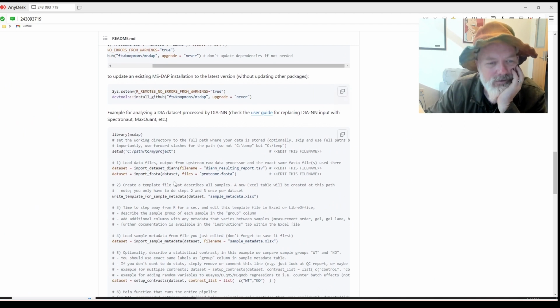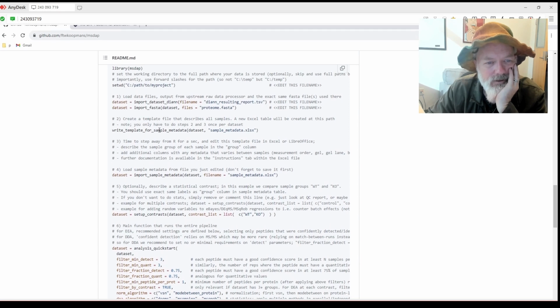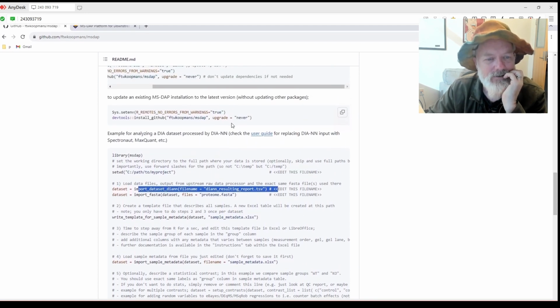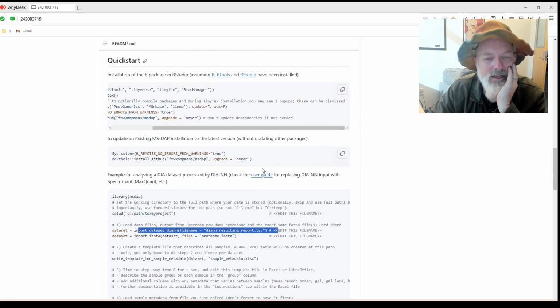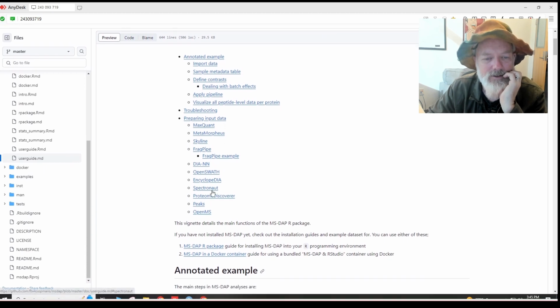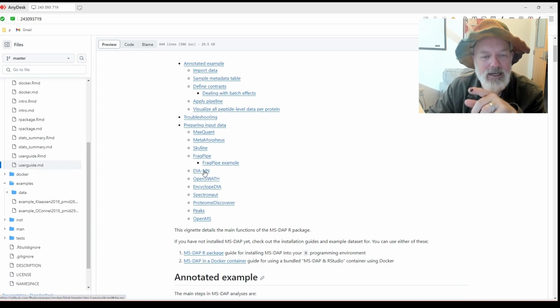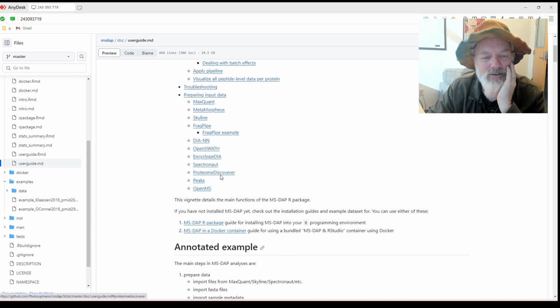Okay, so first of all, the sample one is set up to import from a dataset from DIA-NN. And this would be perfect if you're using DIA-NN data, but we have Spectronaut data. So we're going to have to figure out how to import Spectronaut data. And there is a user guide here. And then you go prepare input data, Spectronaut. There's one for MaxQuant, MetaMorpheus, Skyline. And I think one of the example R scripts is from MetaMorpheus. DIA-NN, OpenSWATH, EncyclopeDIA. I haven't tried that. Spectronaut, so we're going to do Spectronaut.